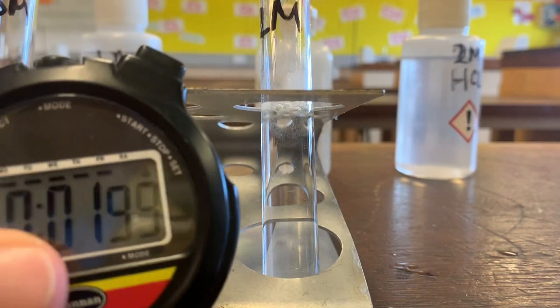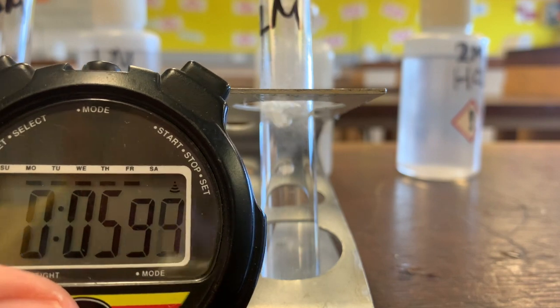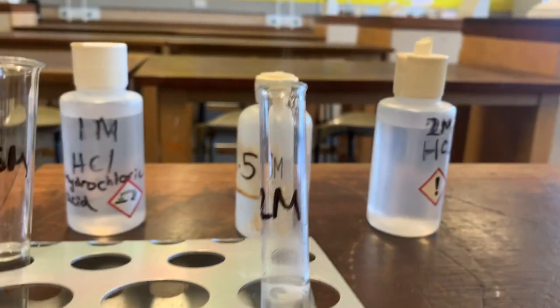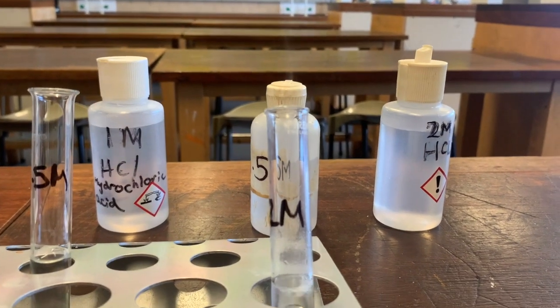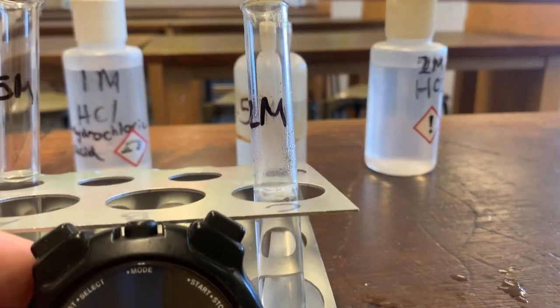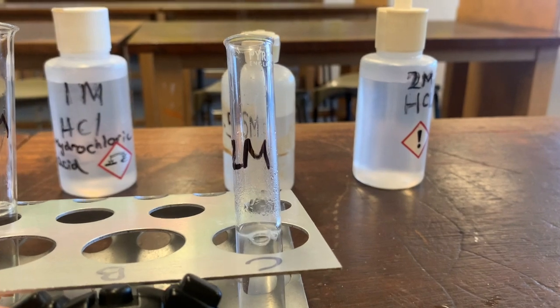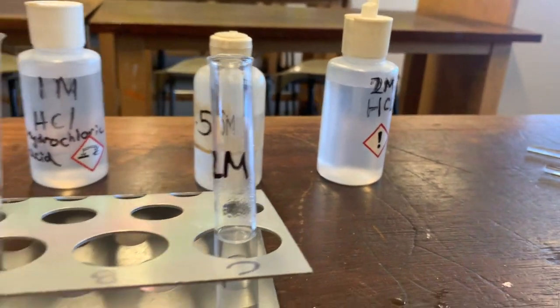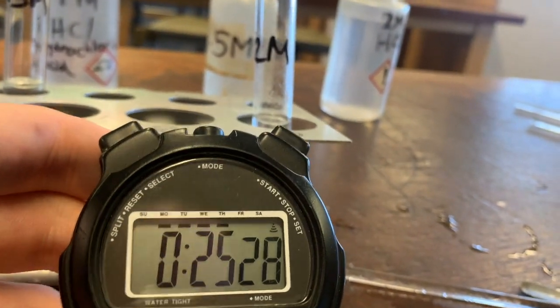There we go — you can see it's reacting incredibly fast, and there's actually loads of smoke coming out of the top here. That's the steam, because the reaction is so quick. Lots of really, really vigorous bubbling going on. And I think it's over — that only took 25.28 seconds.